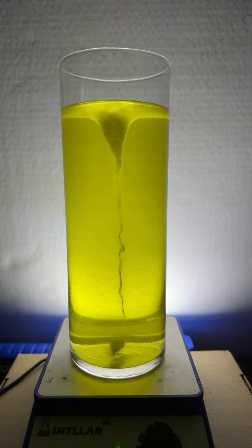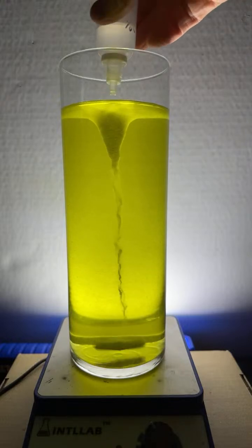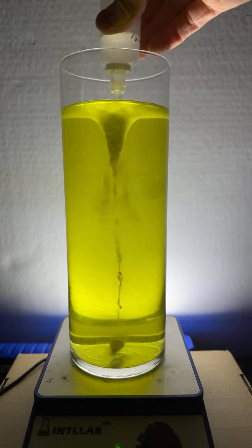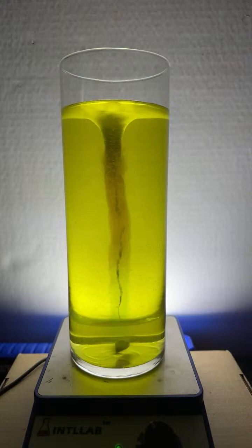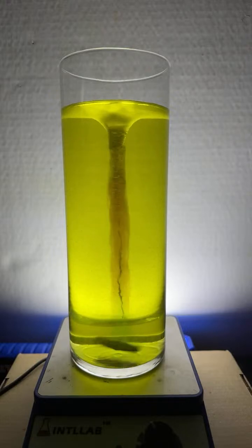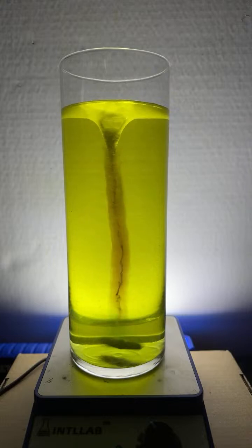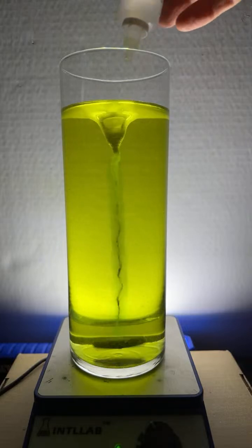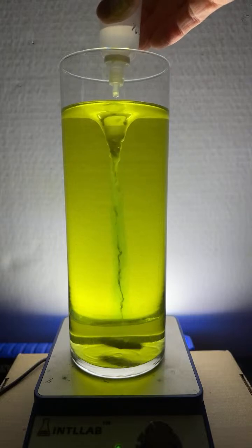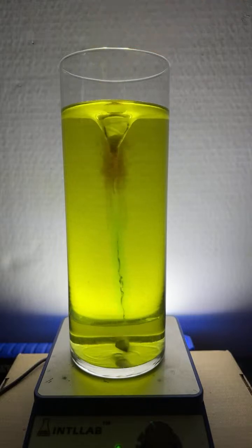All right, I think we're ready. Here we go. In goes drops of base up here at the top. We're going to add 5 drops. In they go. And did you see what I saw? Could you see it? What's happening to the bubbles? They're going away. That should make sense. I'm going to add just a few more drops just to get the rest of it here.